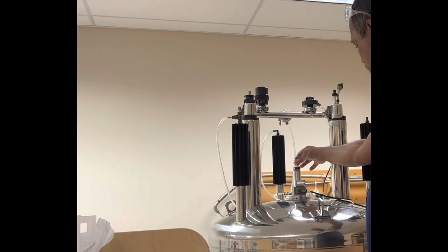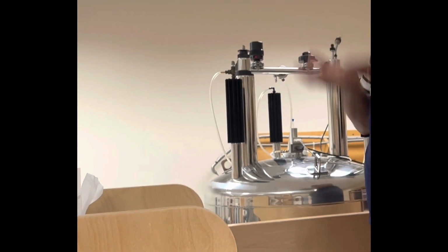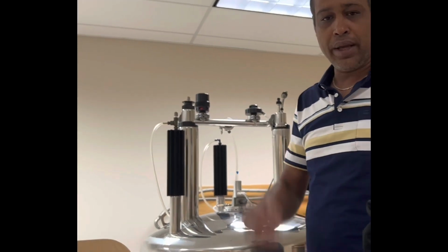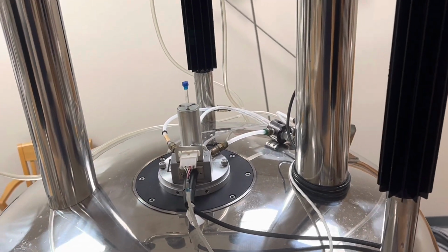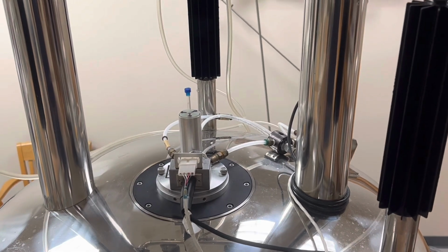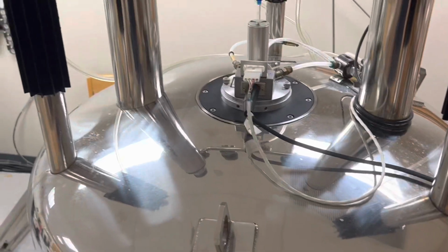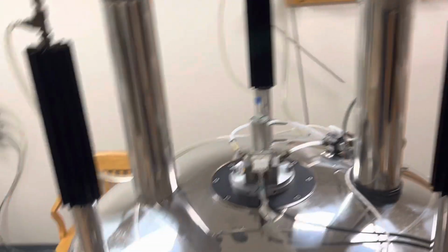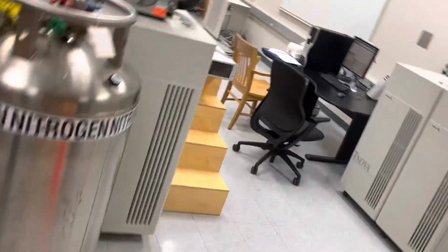Make sure you have air before putting the sample in. You can hear the noise, the sound of air. If there is no air, it will not float. Now it is floating. If there's no air, it'll just fall. So put the tube in the spinner and then put it on there. You can usually hear the sound of the air.